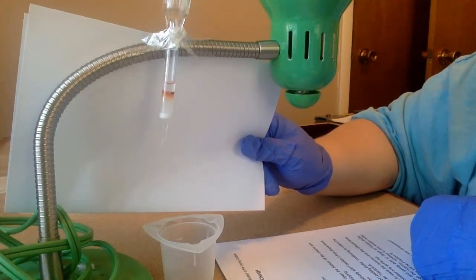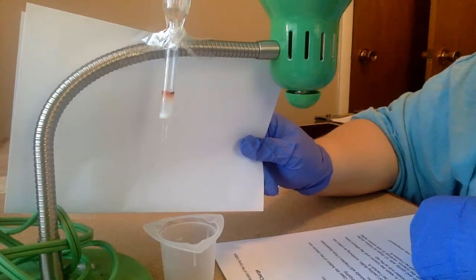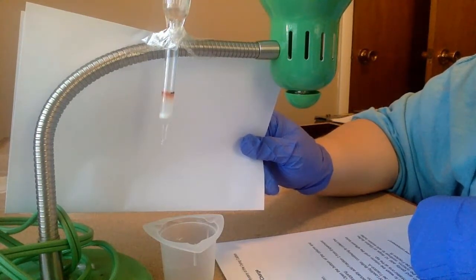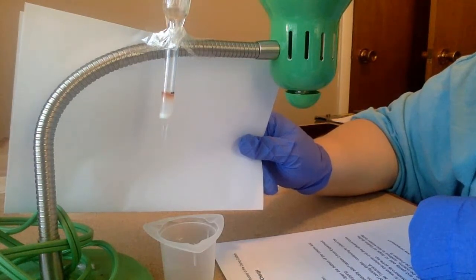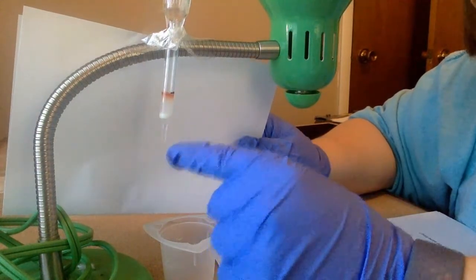But as soon as this finishes dripping through, I am going to change the substance that I am injecting at the top, and it's going to be a base. And what happens, because of the isoelectric point of ruffinotoxin, is that when it's in a basic environment, the charge of the toxin changes to negative. If the charge of the toxin changes to negative, it's no longer going to stick to these negative beads. It's going to wash through.